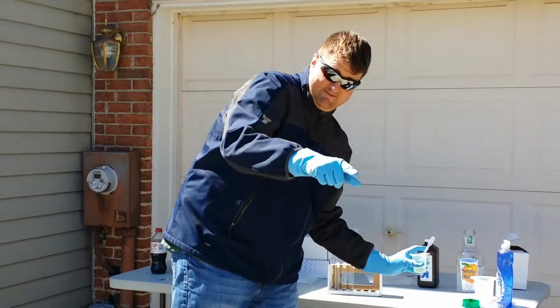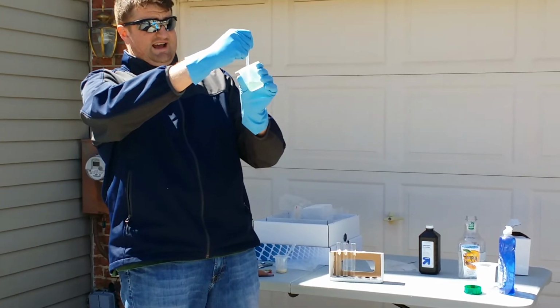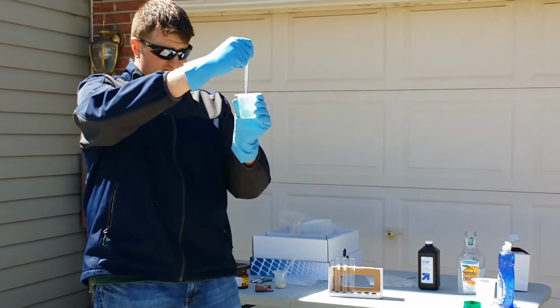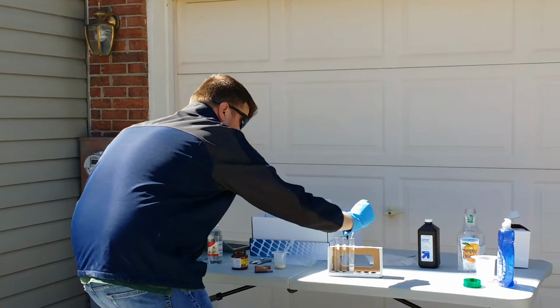And the last one, this is why my son's standing all the way back there. This is going to be bleach. You want to talk about some caustic stuff, we're going to add this to the hydrogen peroxide. And that you really don't want to breathe in. So, just like I said, 1 milliliter each.